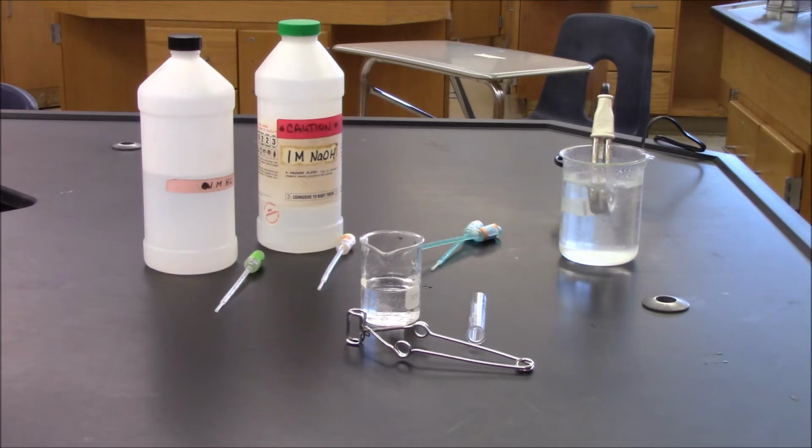take place. One way of knowing that a chemical change has occurred is to observe that the properties of the products are different from those of the reactants. We'll make observations before and we'll make observations after each reaction takes place. At the end of each reaction, we have a new product, and that new product can then become a reactant in another reaction. In this experiment, we will observe a sequence of changes that occur when a solution that begins as copper 2 nitrate is subject to a series of different reactions.